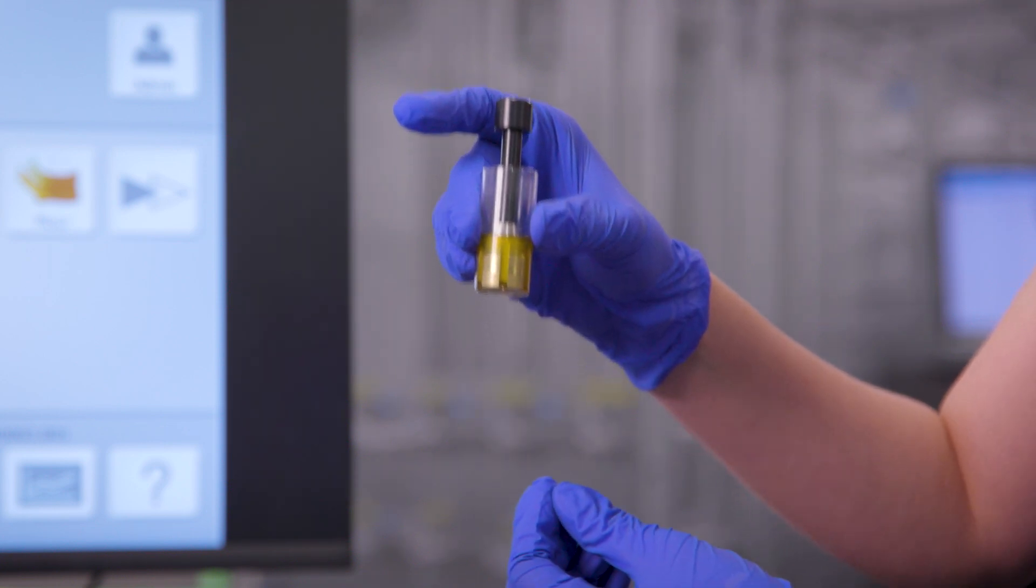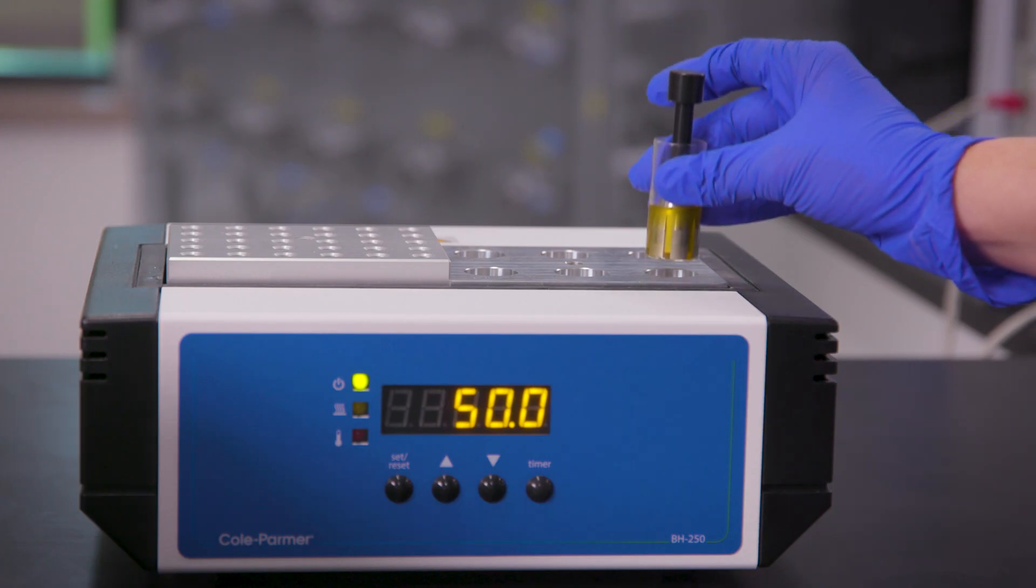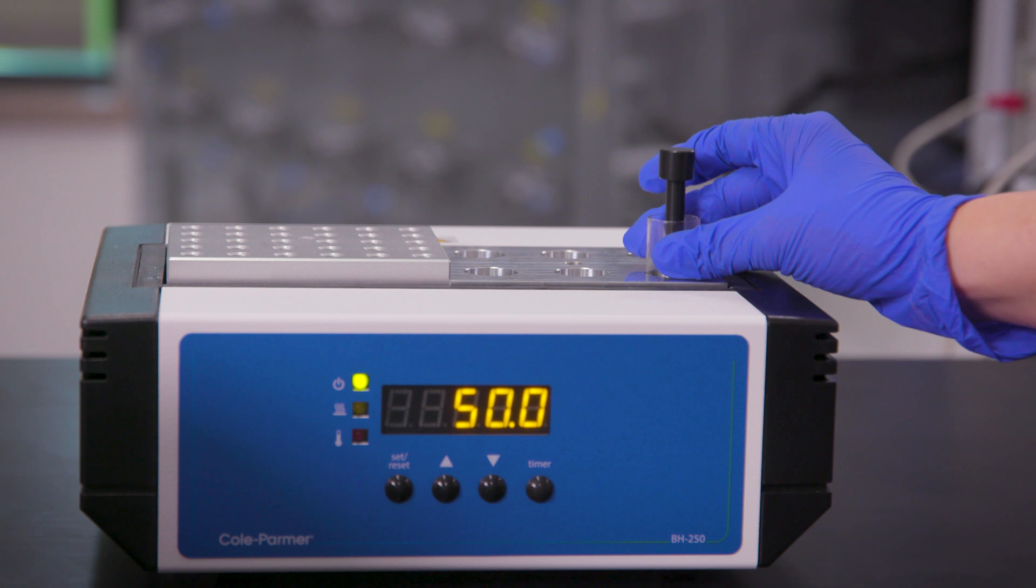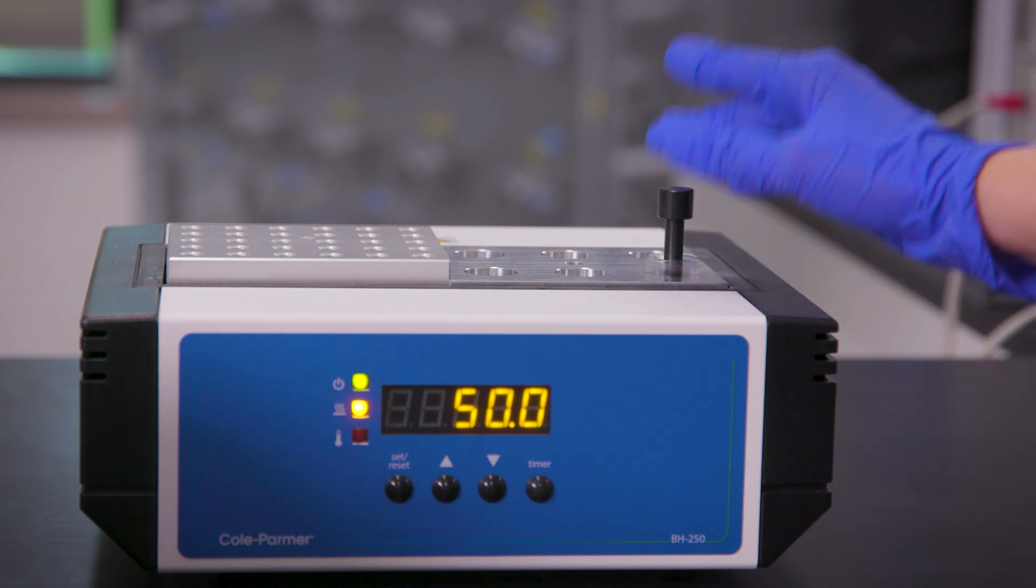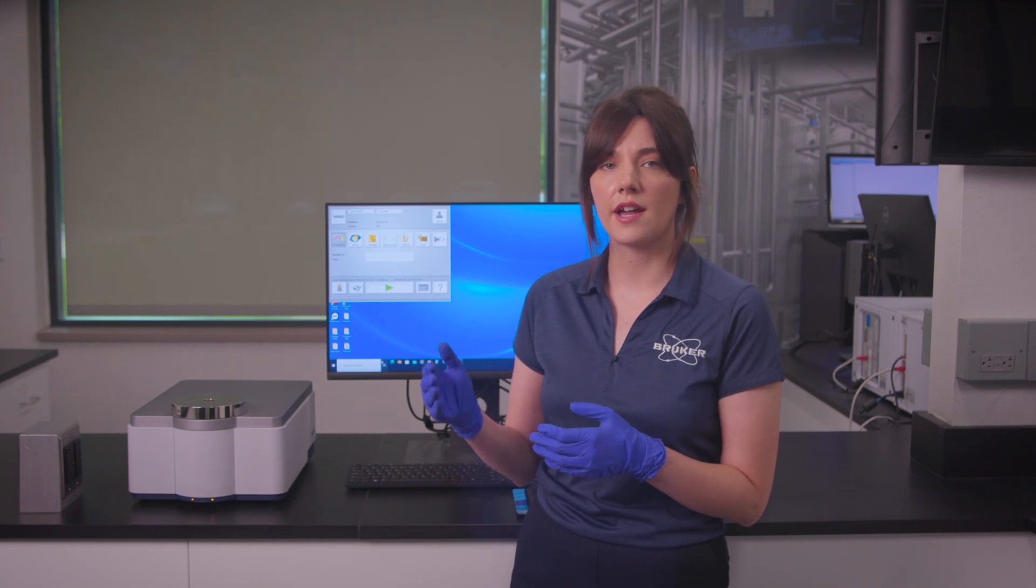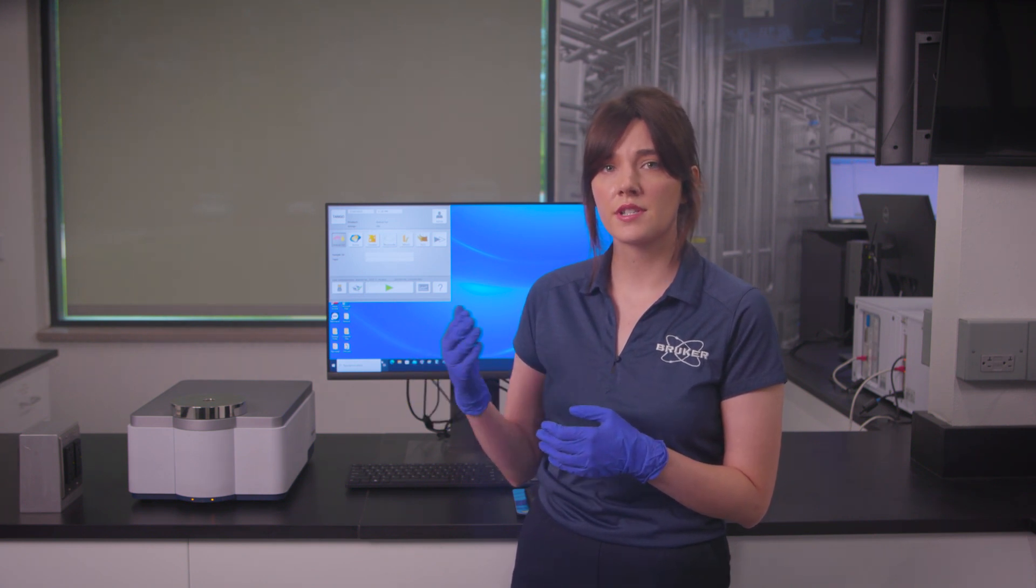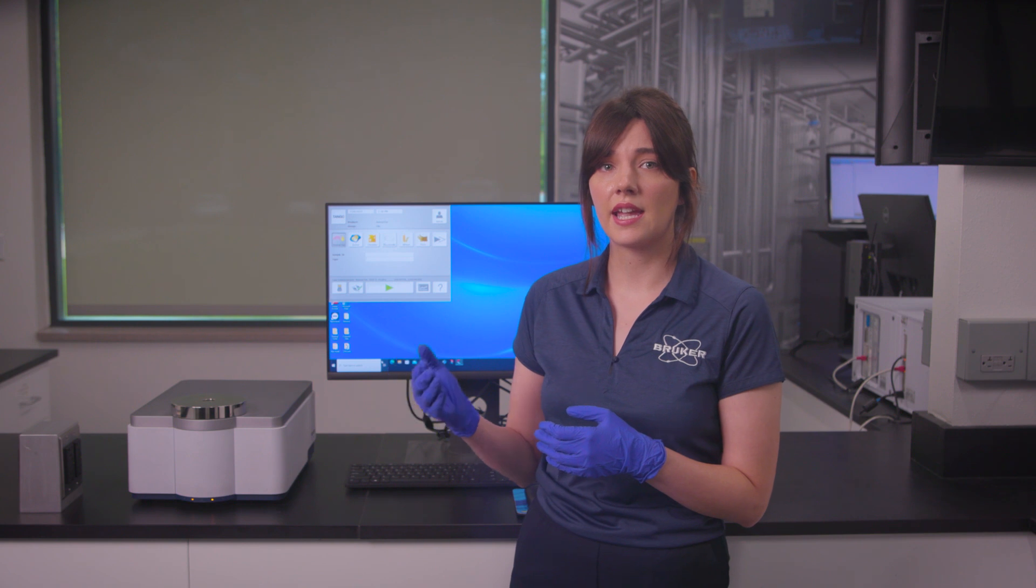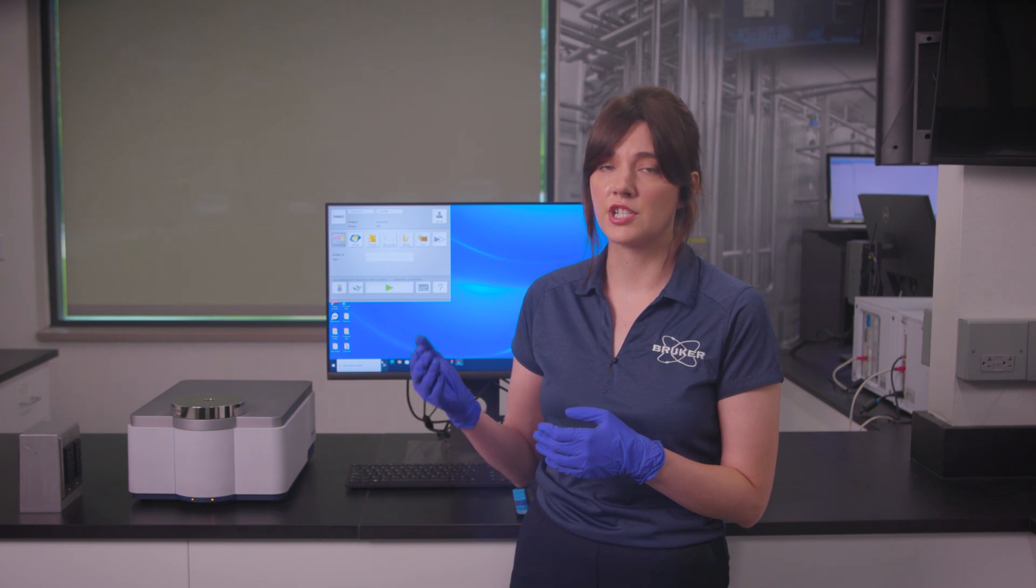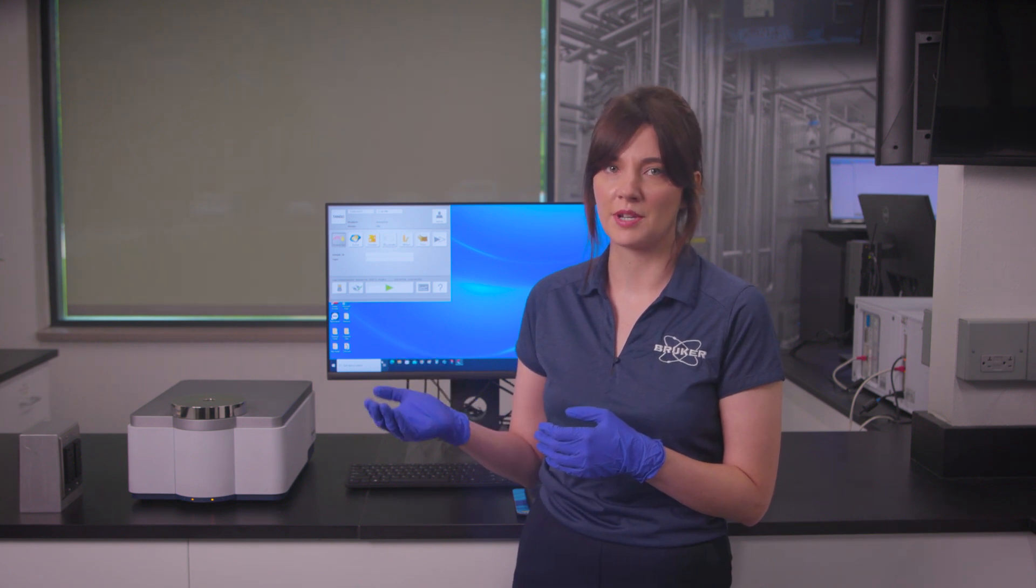Since there is no means of temperature control via the instrument itself, it's important to preheat our sample and keep that temperature consistent up until the moment of measurement. Measuring fats and oils is typically carried out at a predefined raised temperature to ensure it's in a liquid state and to make certain that we achieve great reproducibility between sample measurements. In order to accomplish this, we'll preheat the sample in a block heater with the transmission stamp already in place until ready for sample measurement.